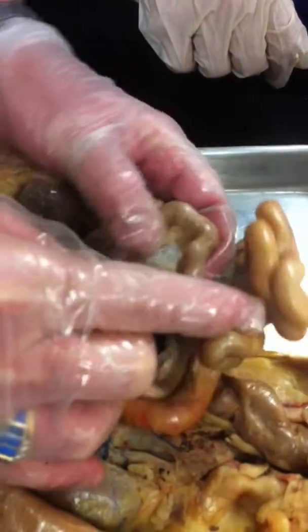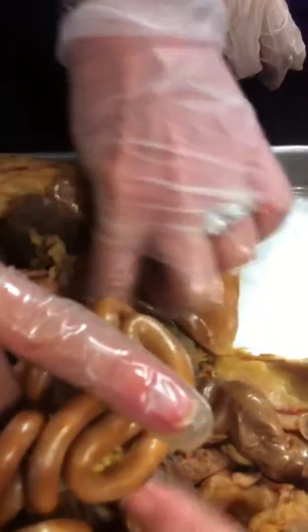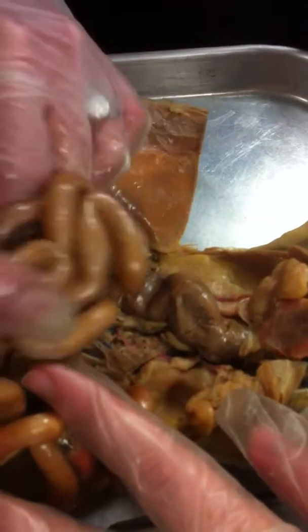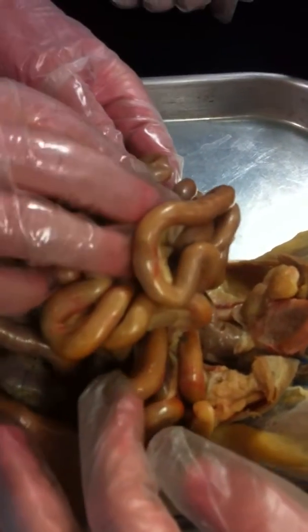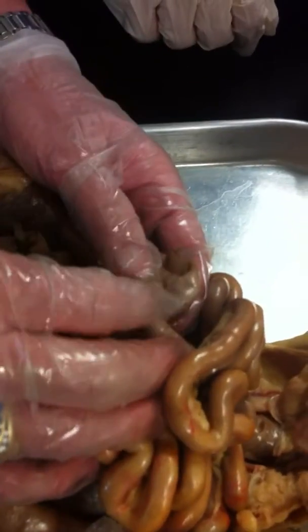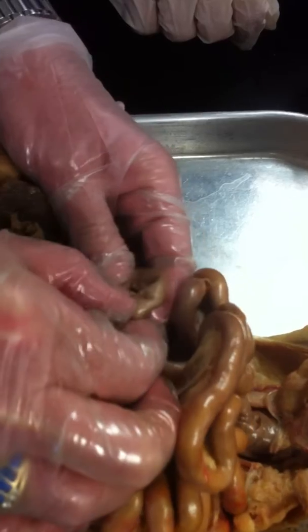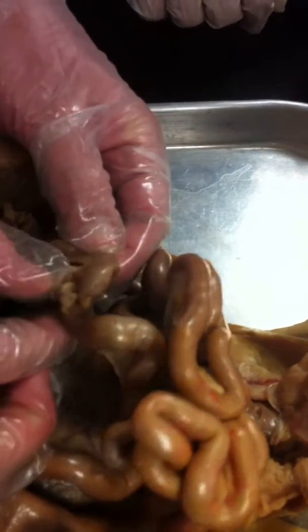And here is the ileum coming into the large intestine. See, here's the large intestine or colon right here. And you see how there's this blind end pouch where they join together? I always think it looks a bit like a turtle head. That's a lymphatic component right there. But right here, that little thing is called the cecum. Now, if you cut open the cecum, see that weird little valve in there?